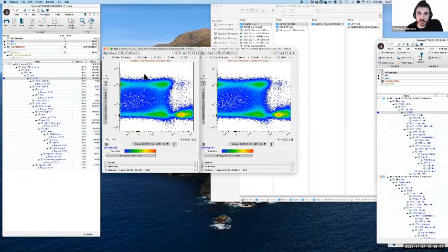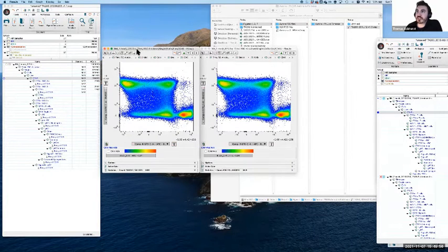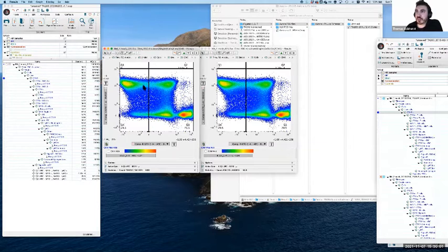This actually relates to the later workshops we're doing on high dimensional analysis, and we'll revisit some of that. But what you notice here is that we get this kind of butterflying of the negative population. So if the center is here where 0 is, you're seeing all of this on the left and the right. All of this is actually the one negative population, but there's this effect which happens in digital flow cytometry after we do compensation, where you get this kind of duplicating effect around 0.